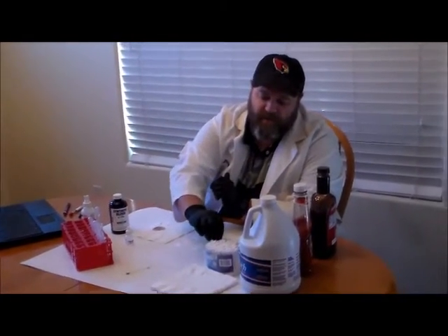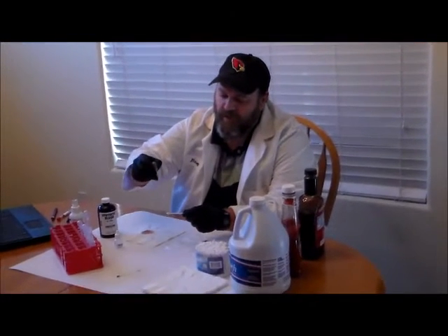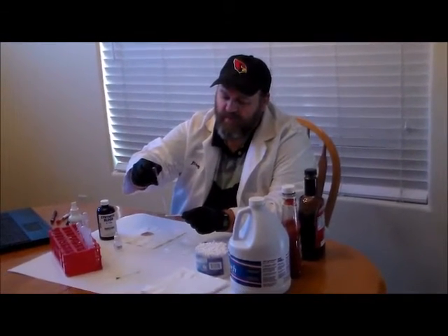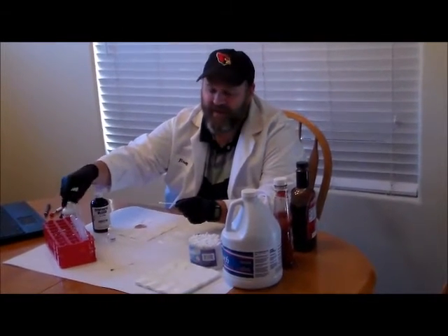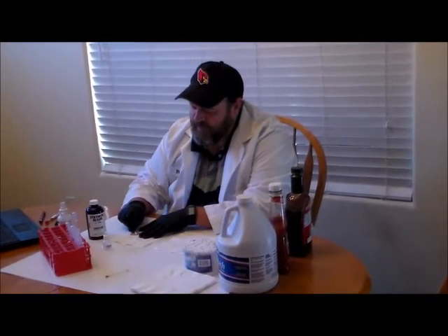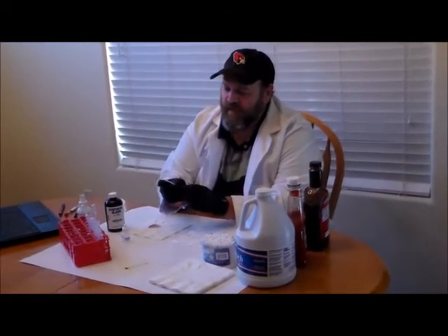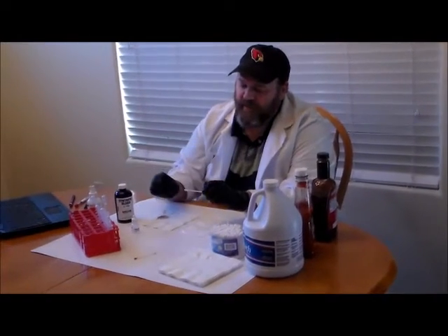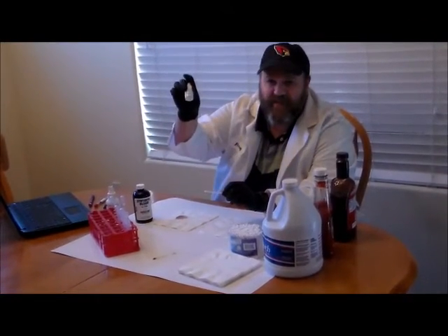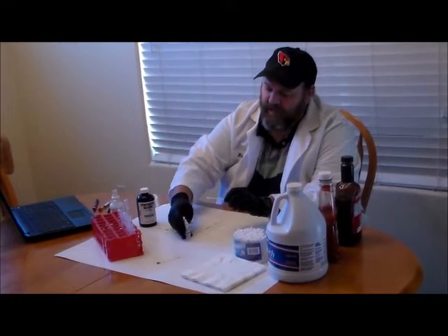Now what if we were to test it using the phenolphthalein, or the Kastle-Meyer? I'm going to take another one of my swabs and moisten the end of it with a little bit of water — notice I'm not touching the end of the pipette to the swab because I don't want to contaminate anything. I'm going to rub the swab against my synthetic blood to collect a small amount of stain. The phenolphthalein test is a two-step test: before adding the phenolphthalein reagent, I first need to add a little bit of ethyl alcohol.